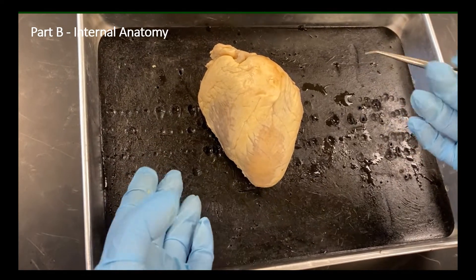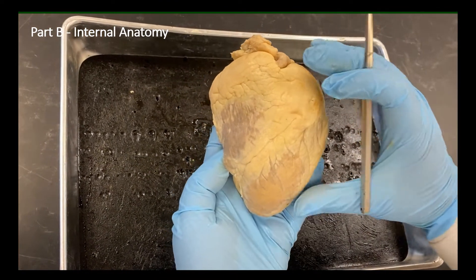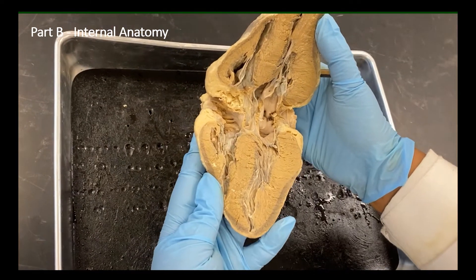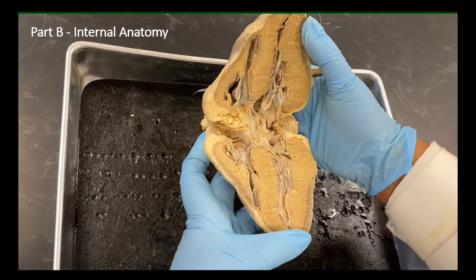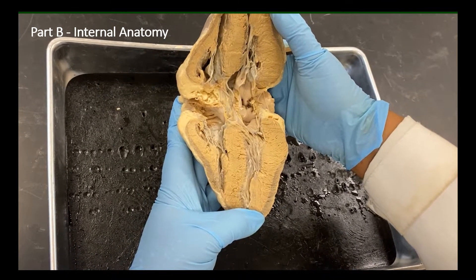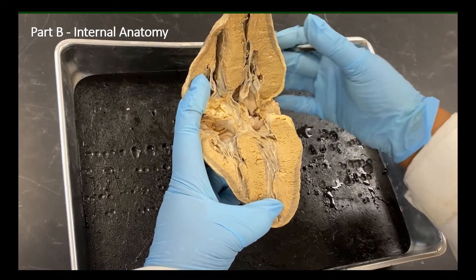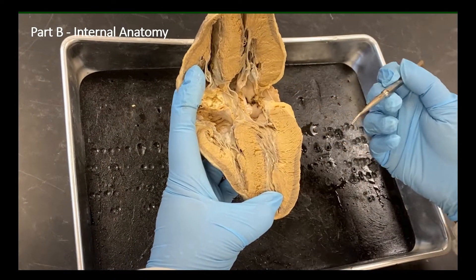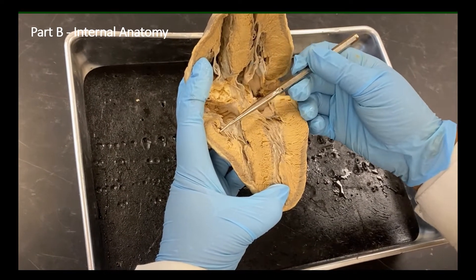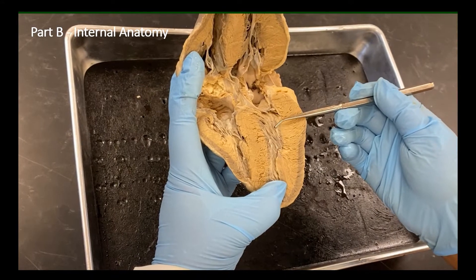Now we will look at the internal anatomy. Let's start from the anterior side. When we take a cross section, we are opening and looking inside. When we look at the interior view, it becomes a lot easier to identify and separate between the left and the right sides. When you look at the ventricles, look at the muscular wall at the side of the two ventricles. This is the right ventricle, this is the left ventricle.